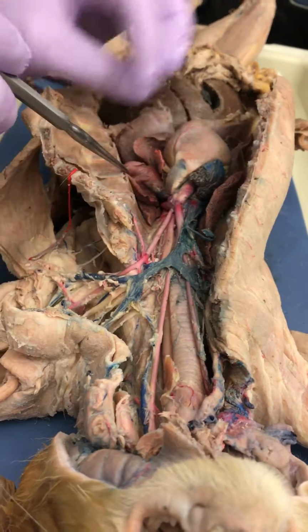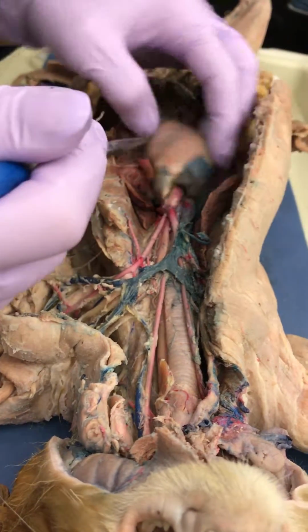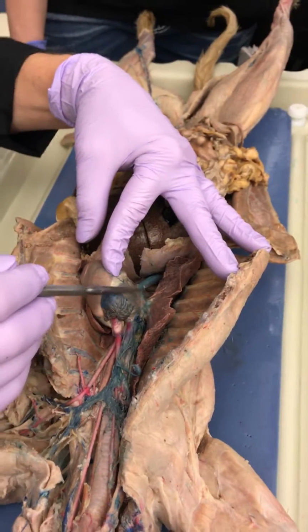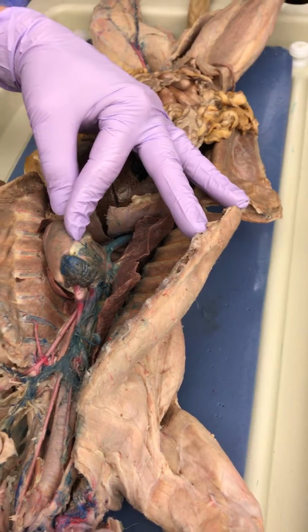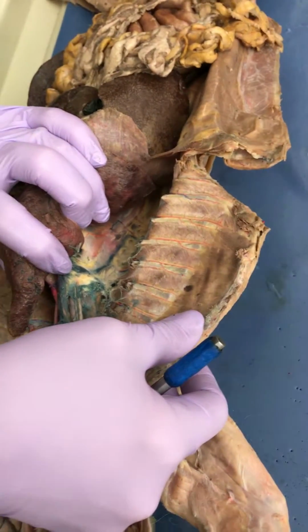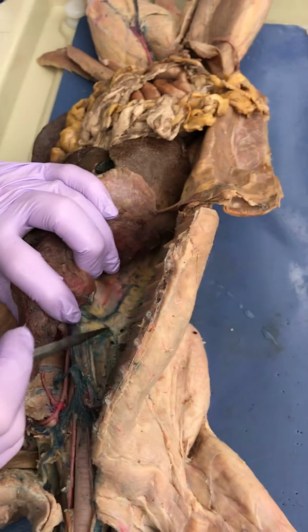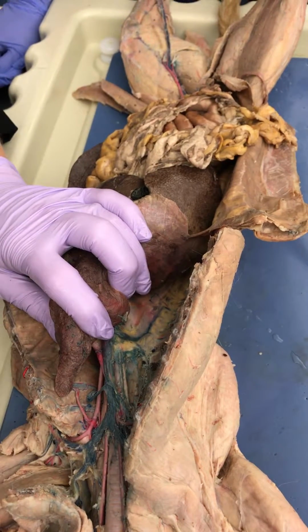All right. You guys know all the parts of the heart. And so the veins coming out of your lungs aren't great. I think it was that cat over there that has the pink good ones. Yeah. Let's see what your azygous vein looks like. Oh yeah, you got a pretty good one. Yeah, good azygous vein. You see that, Casey, right there? Yeah. So it comes up the right side. Just the right side.